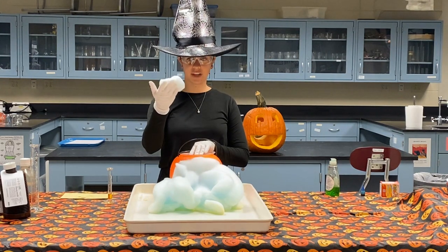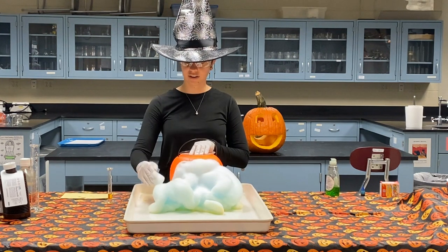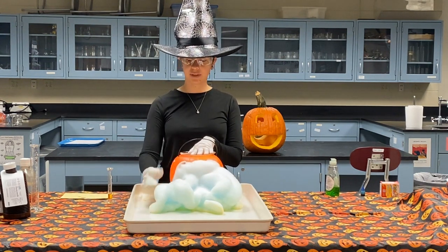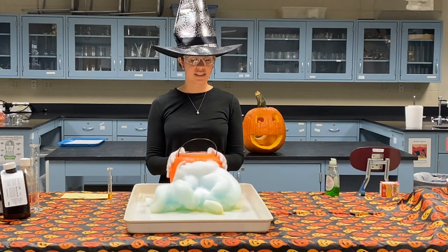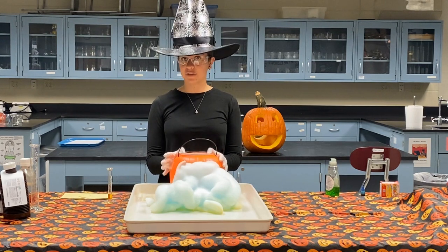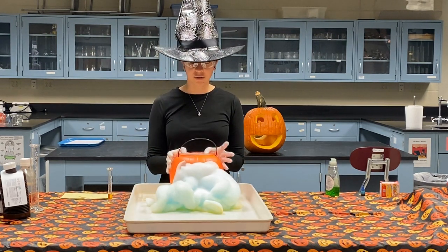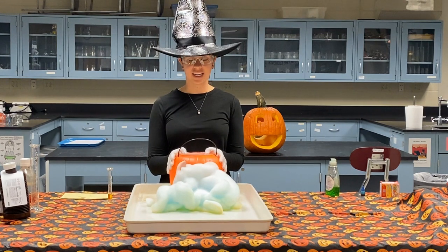Now, even the foam is very, very warm to the touch. Remember, I have gloves on. That's the only reason I'm allowed to touch this currently. I did cover up the top, otherwise it would have shot out of the top as well. If you're curious about other versions of this demo, this is often also referred to as the elephant toothpaste demo, and if you do that in a large graduated cylinder, you kind of get a giant toothpaste effect. So that is just another variation on our hydrogen peroxide decomposition.